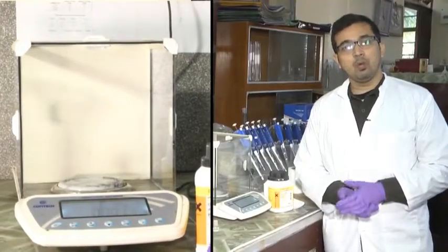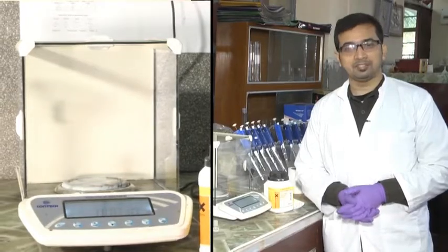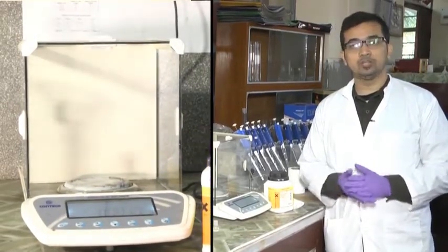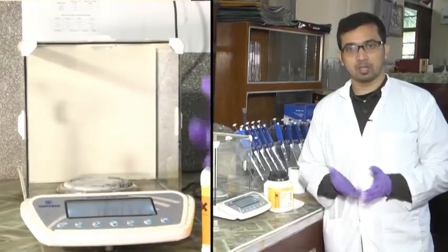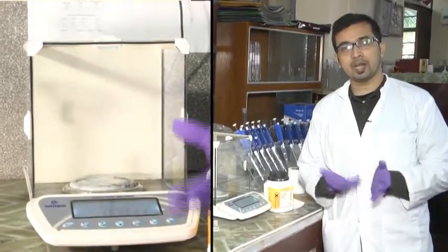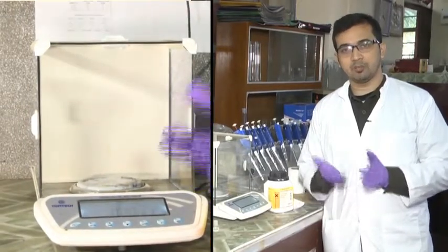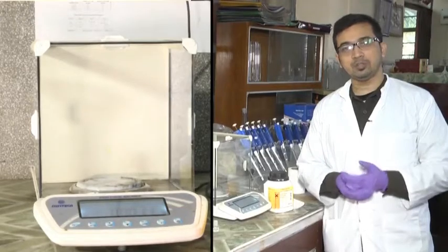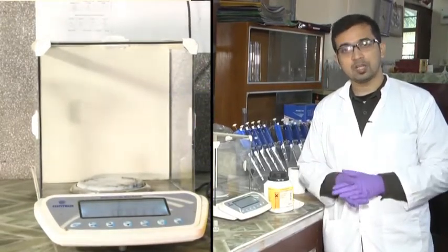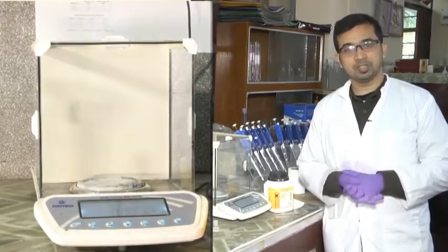Hello everyone. We will begin with the titration of an acid and a basic amino acid. Before that, we are using a separate form of the titrant, NaOH. We are preparing another set of NaOH, and for that we have to follow the methods from the beginning: first prepare oxalic acid, then prepare fresh NaOH and HCl, followed by proper standardization.